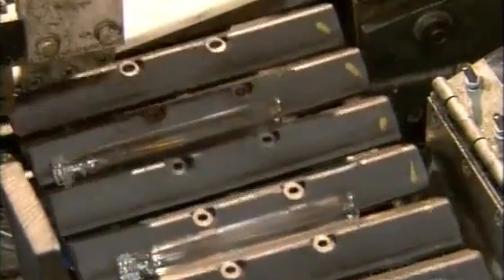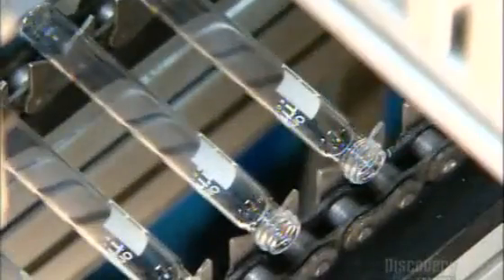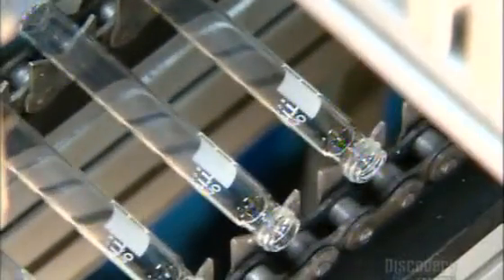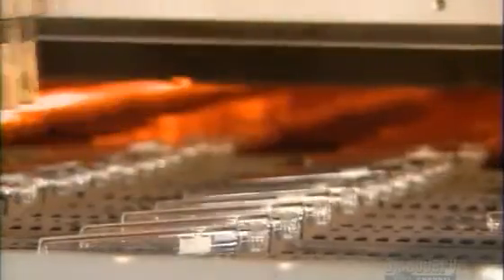The vials now slide down to what's called an afterformer machine. Here, suction cups lift and place each vial into metal grooves on a printer bed. It's a basic silkscreen printing process, with a squeegee pushing paint through the screen's holes onto the vial. Grippers now place the vials on a rack headed for the oven, where they'll bake for about 20 minutes.